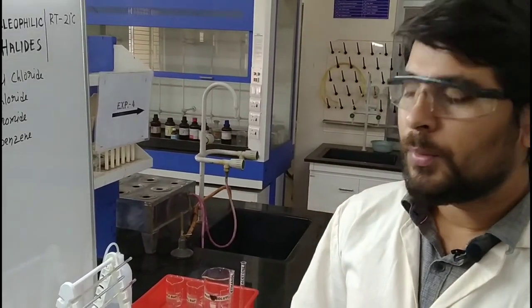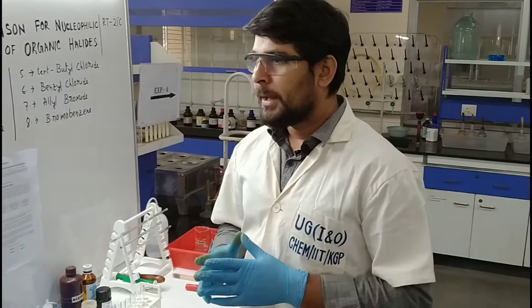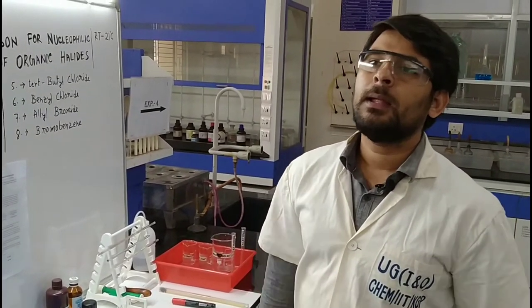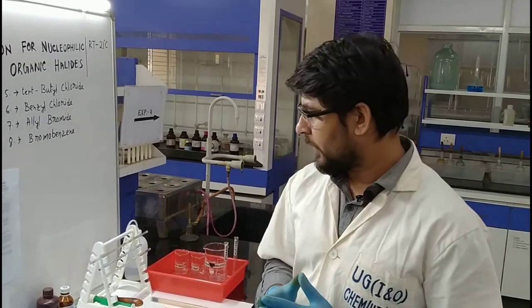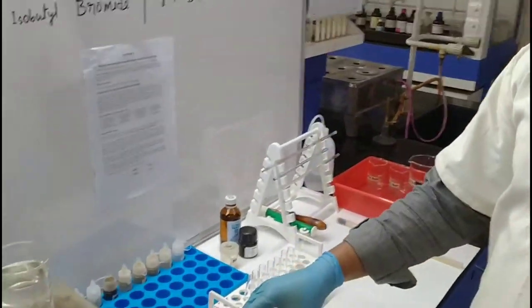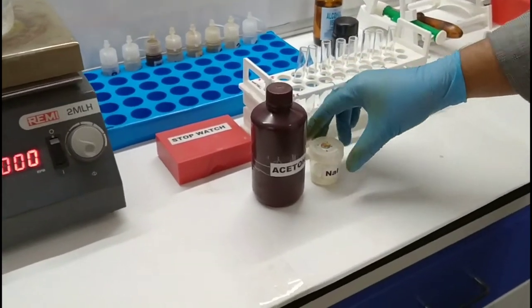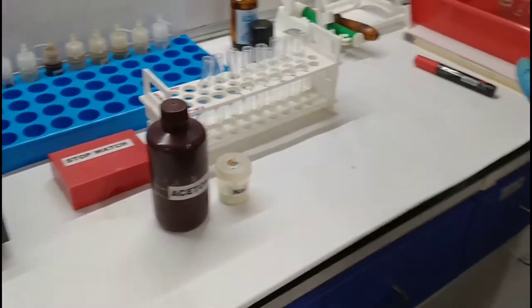We are going to perform SN2 first of all. For SN2, what is required? A 10% NaI solution in acetone is required. These two chemicals — acetone and NaI — are required and we have to prepare the solution in this container.